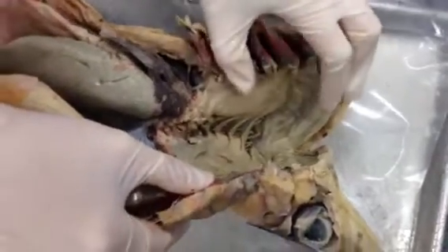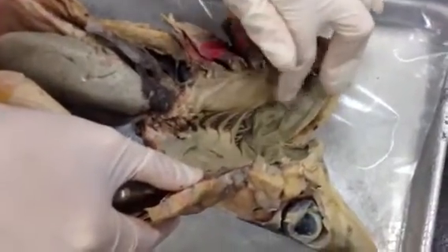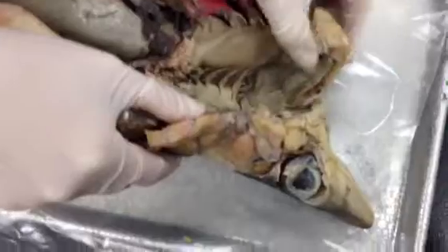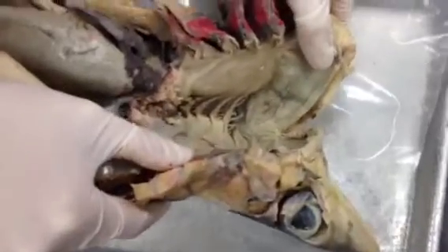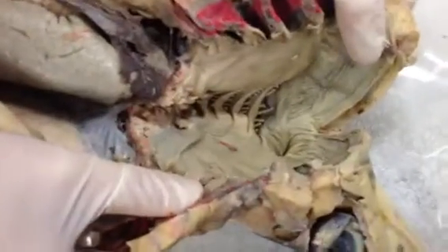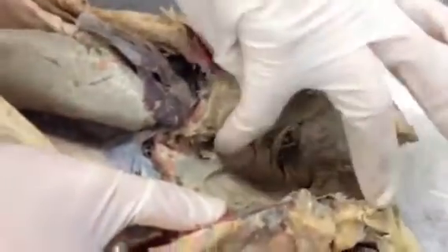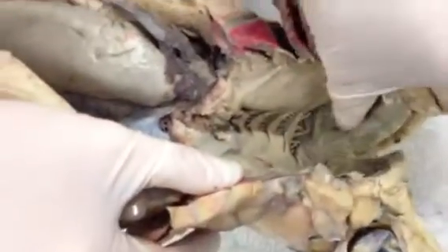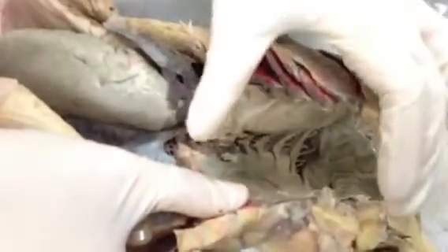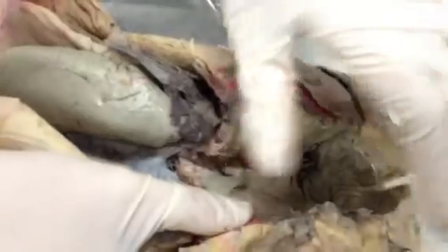What you're looking at here is the oropharyngeal cavity. It's called the oropharyngeal cavity in sharks because it's hard to distinguish what part is the oral part and which one is the pharyngeal part, so the whole name is oropharyngeal cavity.